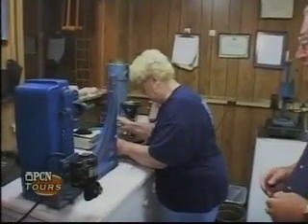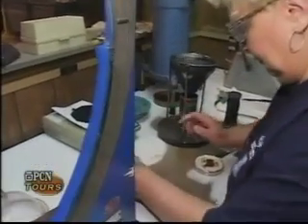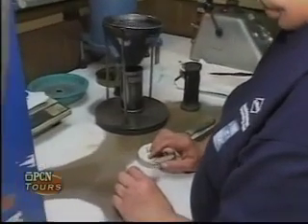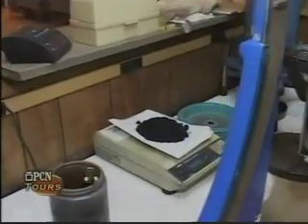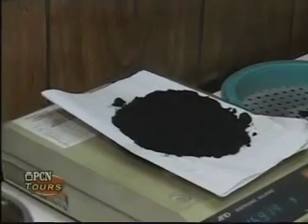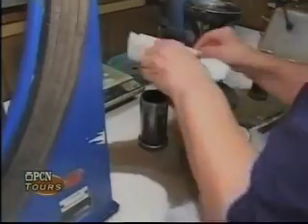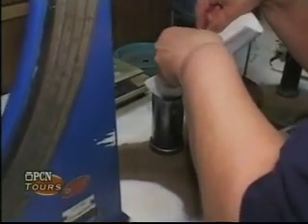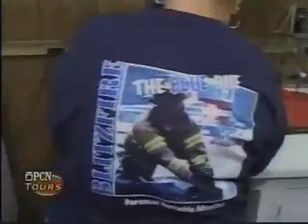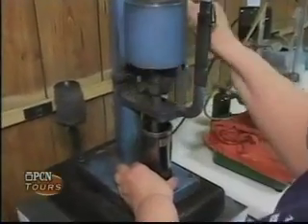What we're doing here in our sand lab is we have 2 separate sand systems, and Betty is doing a sample analysis on the sand, where she is weighing out a specified amount of sand that would be put into what we call a 3-ram compactability. All right, she's going to put the sand into the cylinder. That'll be placed on the compacting unit. That's a specified weight. That will ram 3 times.